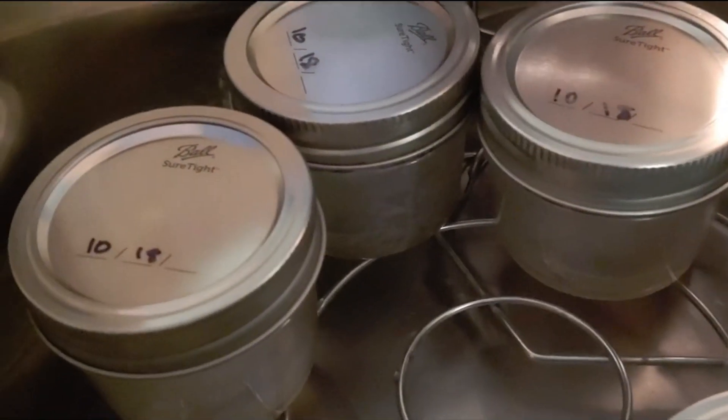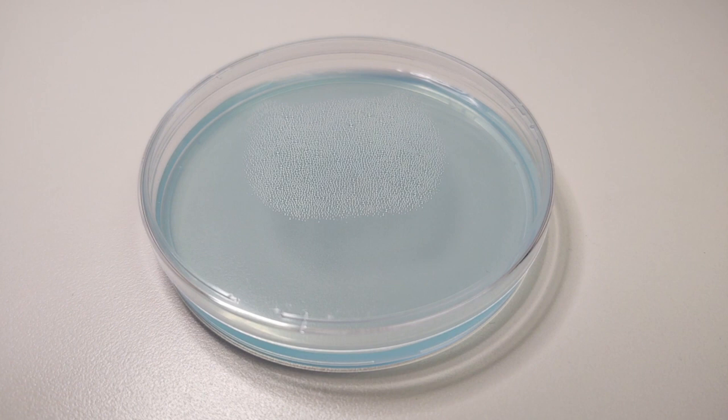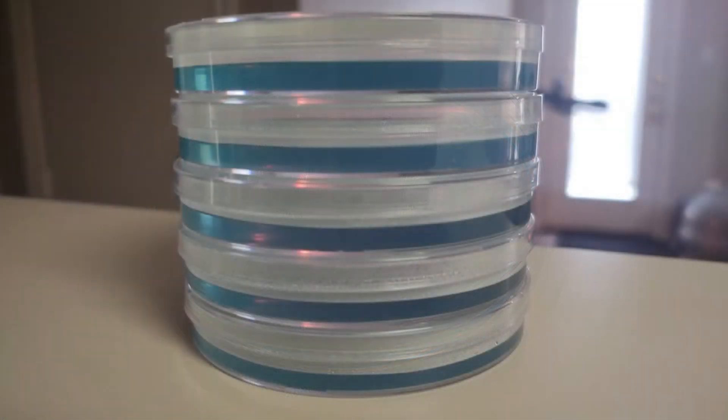Allow your plates to cool to room temperature. If you see condensation, just flip your plates upside down. You can even store them upside down. We recommend that you wait 24, 48, even 72 hours to make sure that your plates do not have any contamination before you use them for transfers or spores.